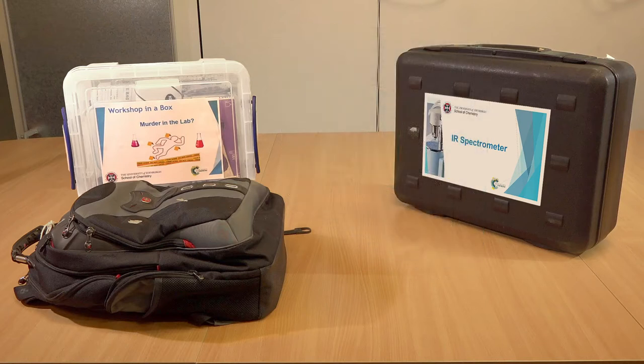The UV-VIS spectrometer is dealt with in a separate video. You will want to set up the IR spectrometer at least 30 minutes before the class. It can be left to one side if you have other classes beforehand. This allows it time to warm up and for the internal dehumidifier to run.